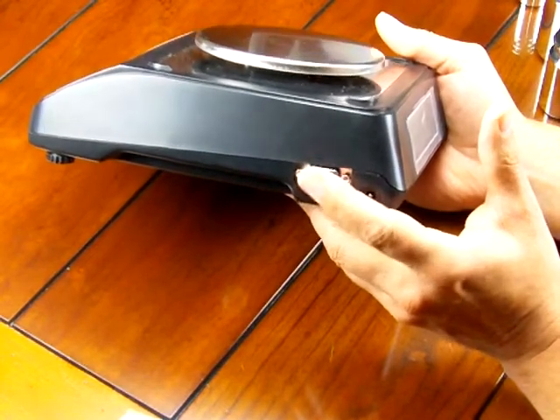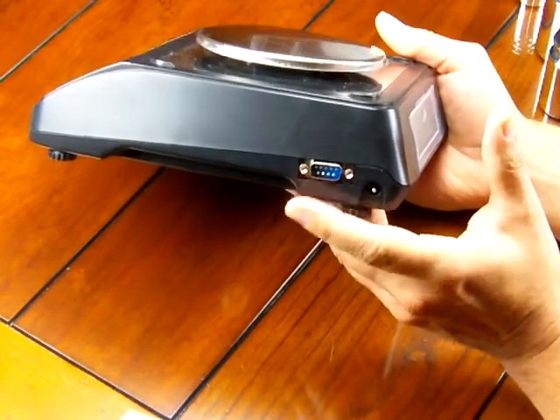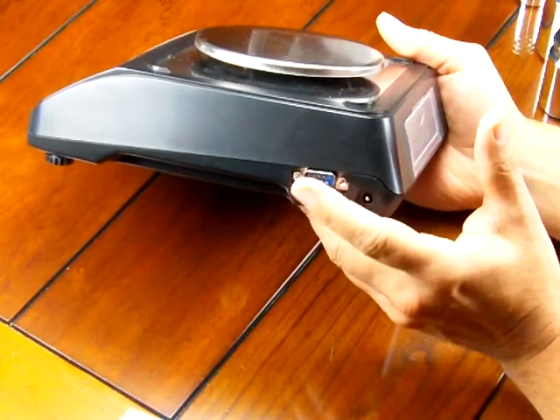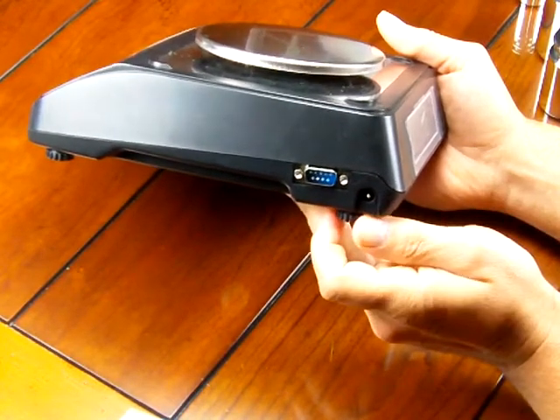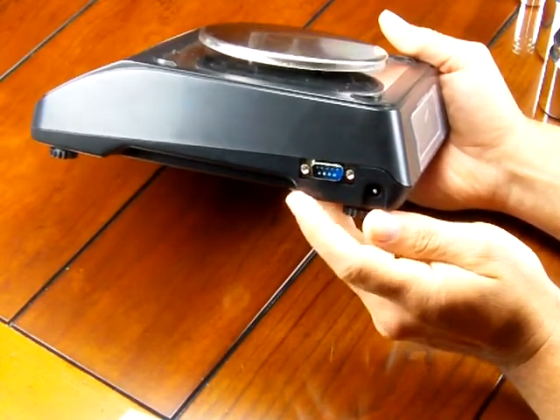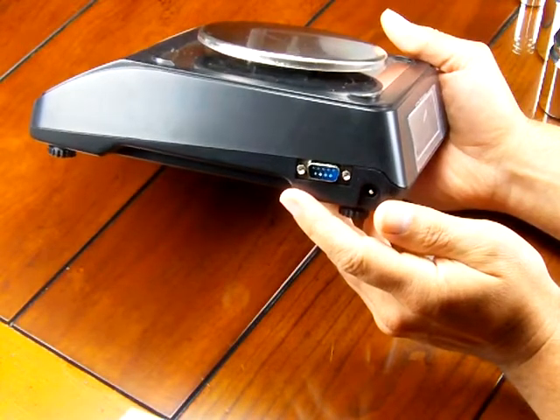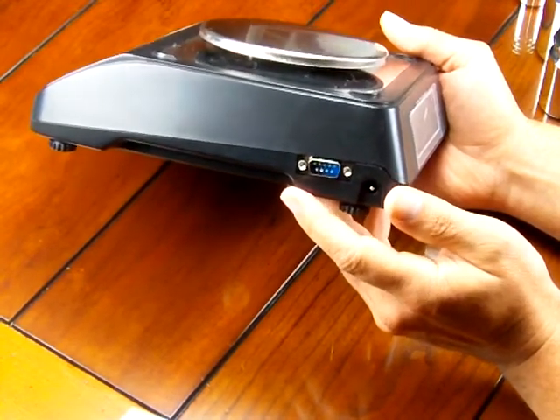But again, precision weighing balances will not support any questions on this RS-232. I mean, there's just so many people that have no clue how to connect a scale to a PC. Also, a lot of times you have to buy software.